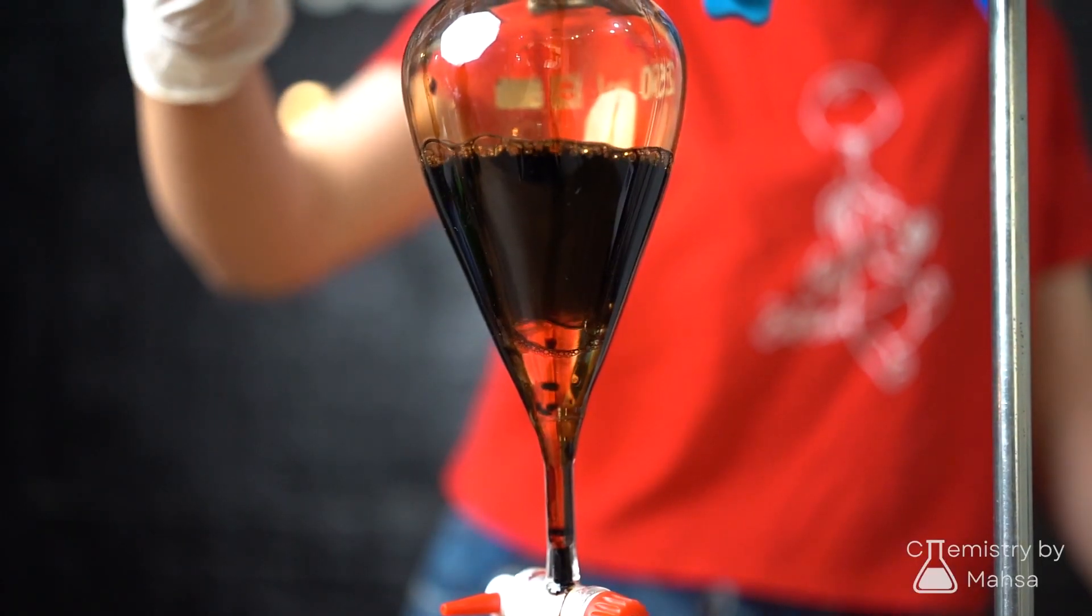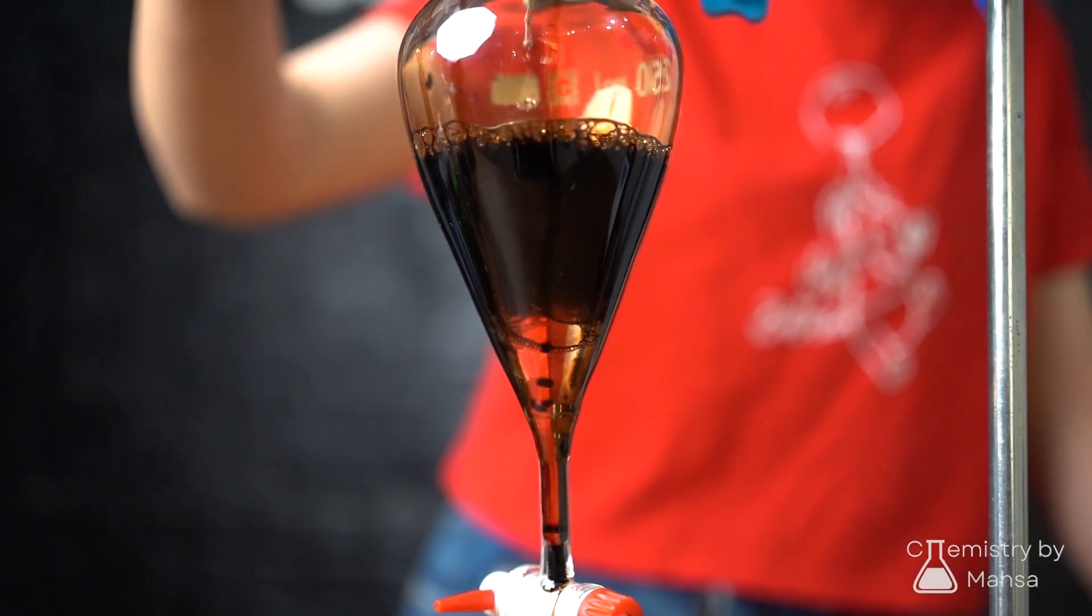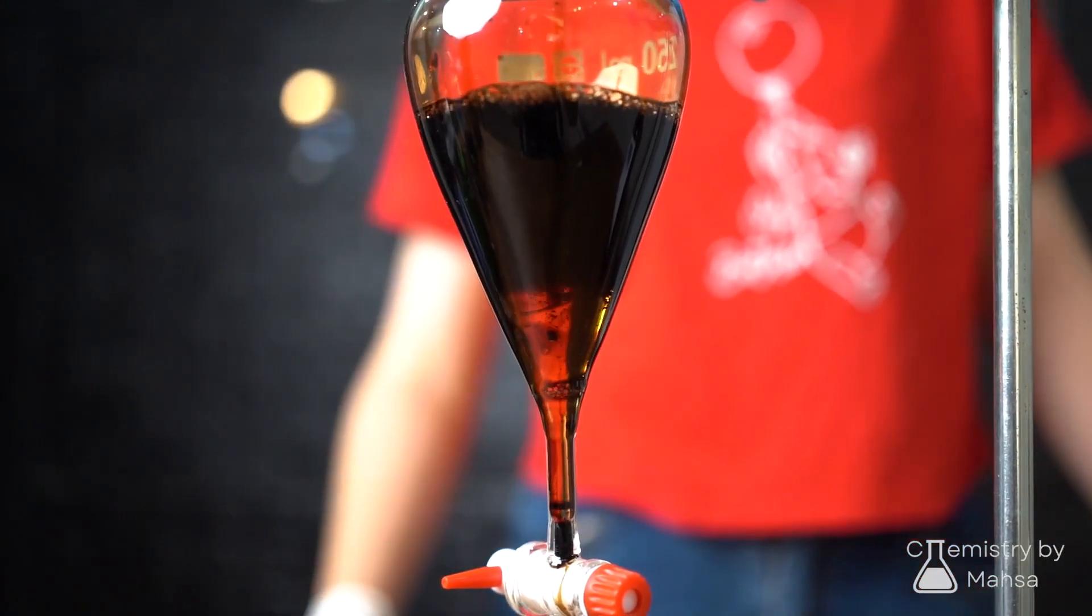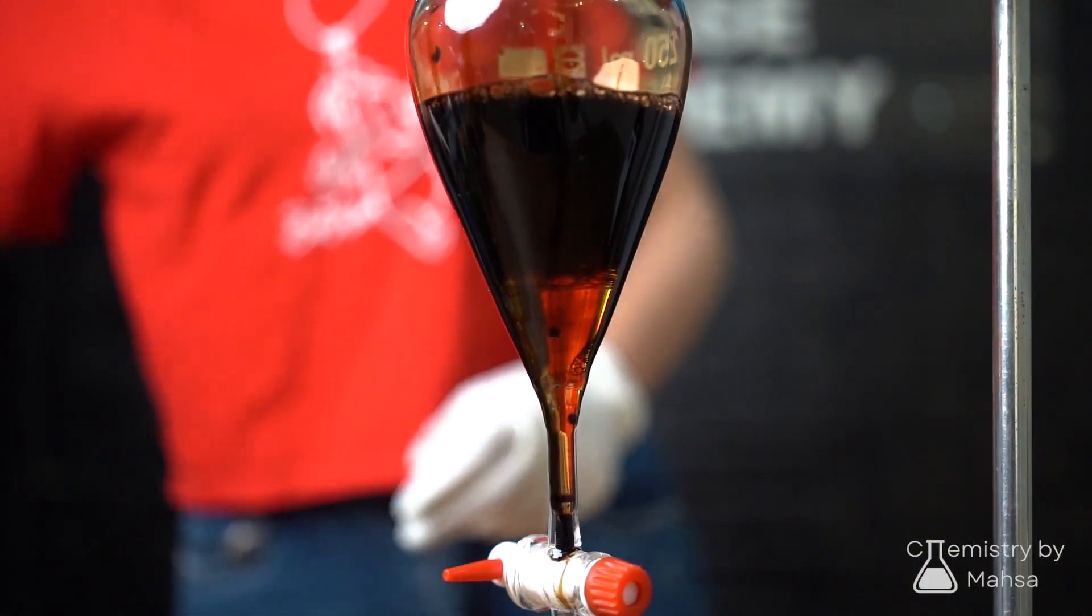After a few minutes, you'll observe the separation of two layers. The color difference and distinct line between them makes the separation straightforward and beautiful.